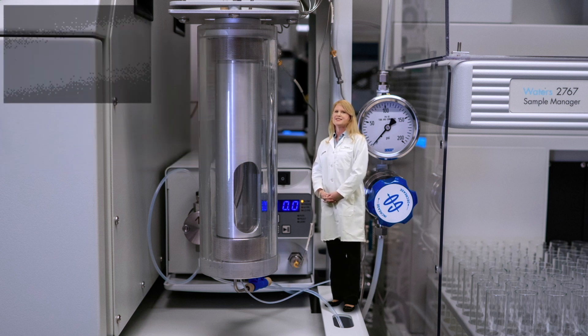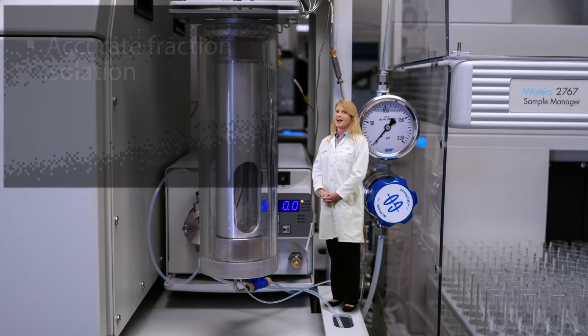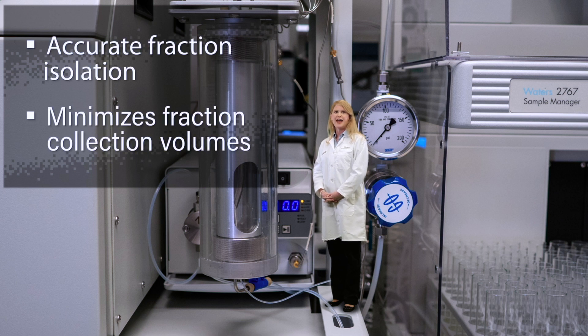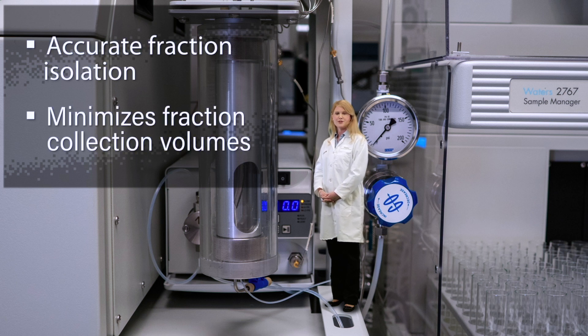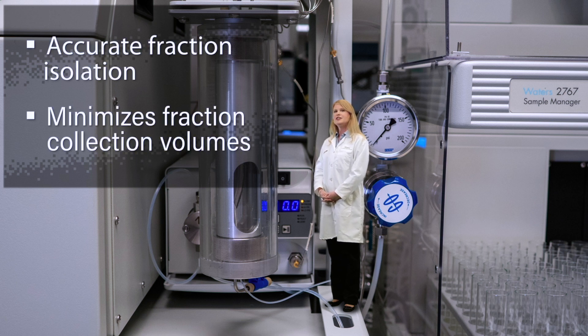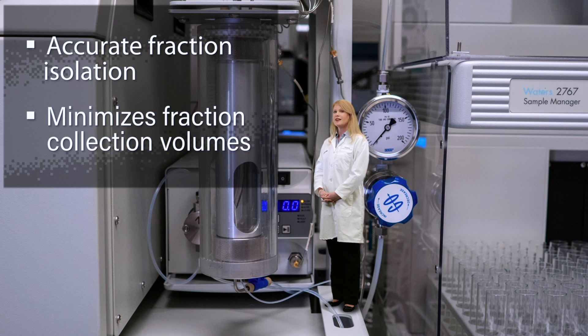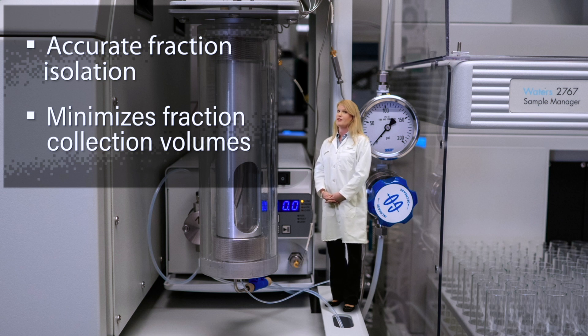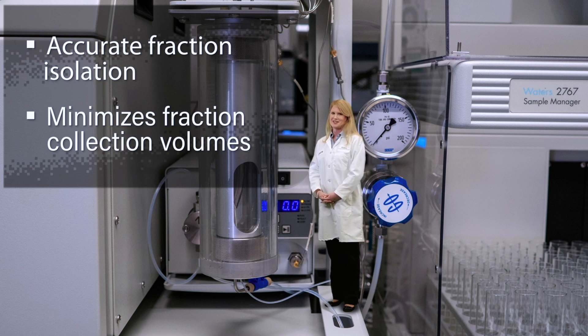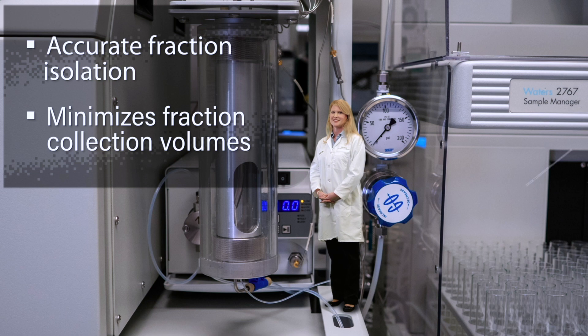The GLS design allows accurate fraction isolation and minimizes fraction collection volumes. Decreased fraction collection volumes reduce overall solvent evaporation time and processing costs.